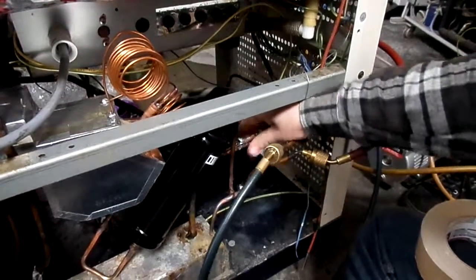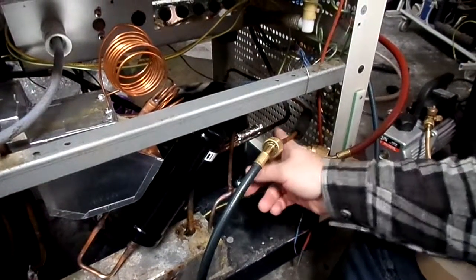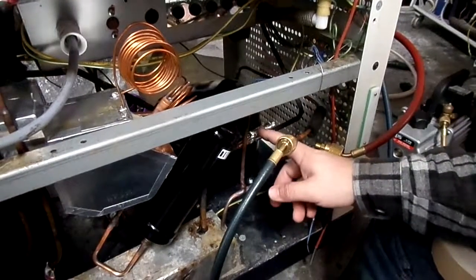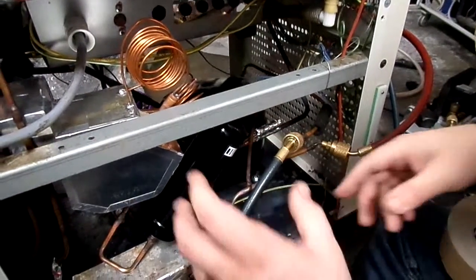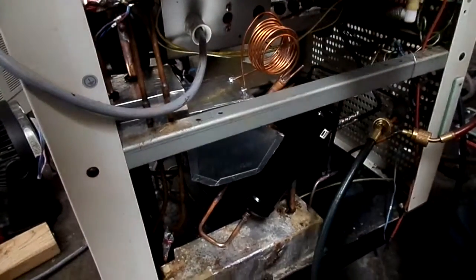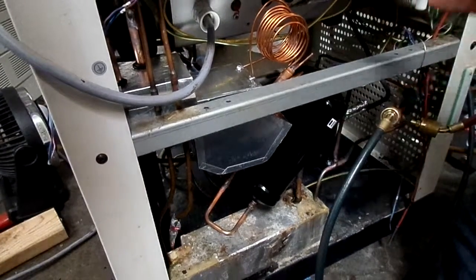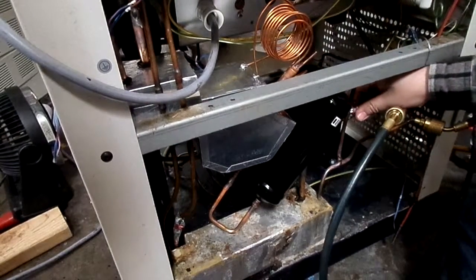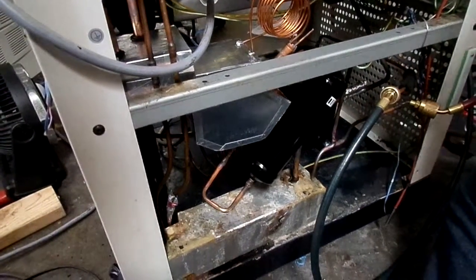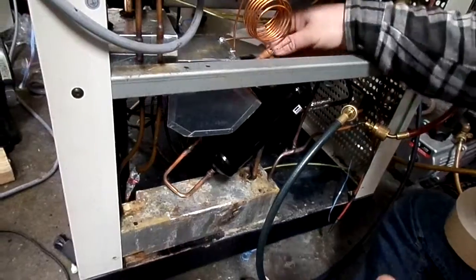It just needs to make contact with that return line, because how it works is this return line gets cold to a certain temperature as the chamber cools down, which will cool down the bulb as well, which decreases the pressure inside, closing the valve inside here, restricting the flow of Freon further. When it restricts more, it makes the expanding Freon colder. So if it doesn't have that ability to change with the temperature of the output, it's going to not cool efficiently. It'll stick at negative 15 degrees or something rather than pulling negative 35. They're variable. That's your science lesson for the day.